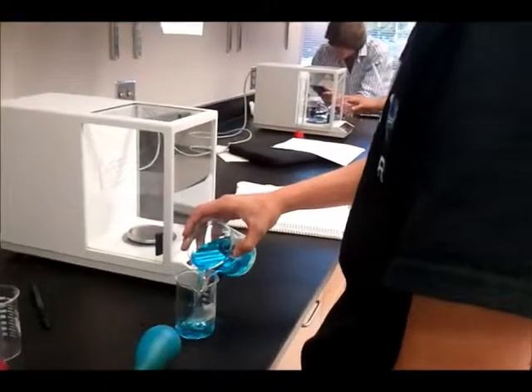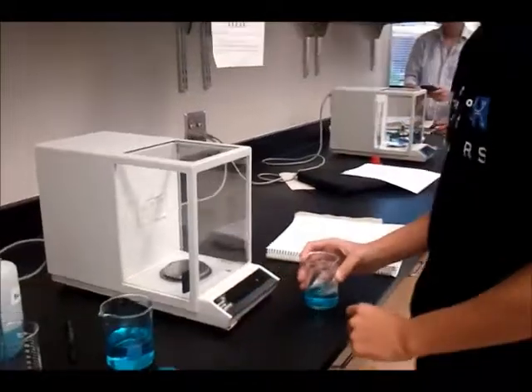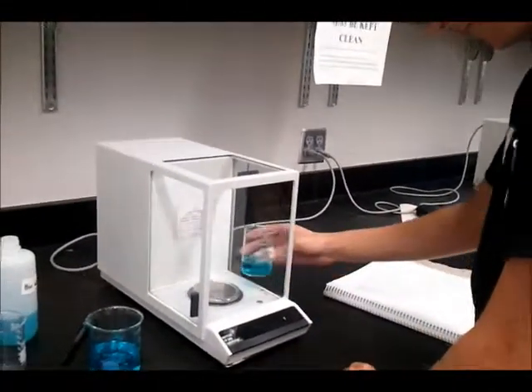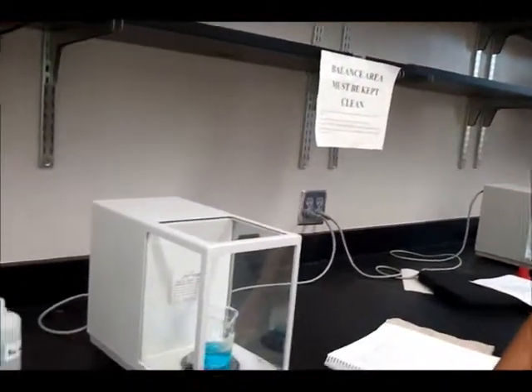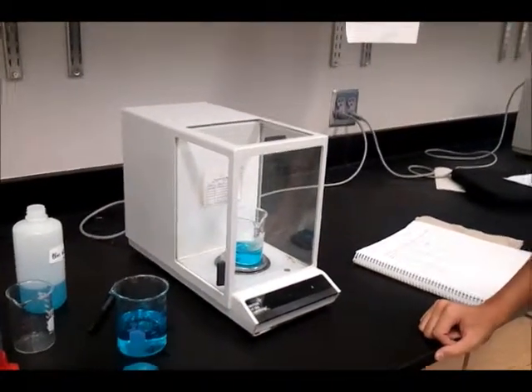To measure a liquid, make sure the liquid is placed in the beaker outside of the balance. Then, place the beaker on the balance as it was before. Take the reading again and find the difference of the two readings to find the mass of the liquid.